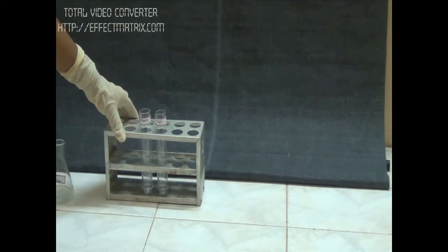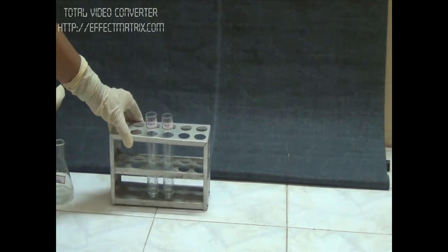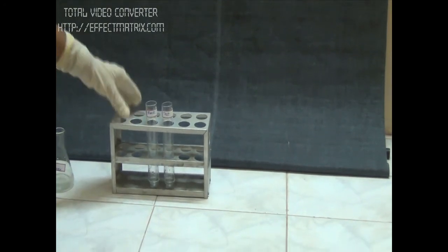Now that I've added the substrate, buffer, and enzyme, we'll incubate the tubes at 55 degrees for 15 minutes.